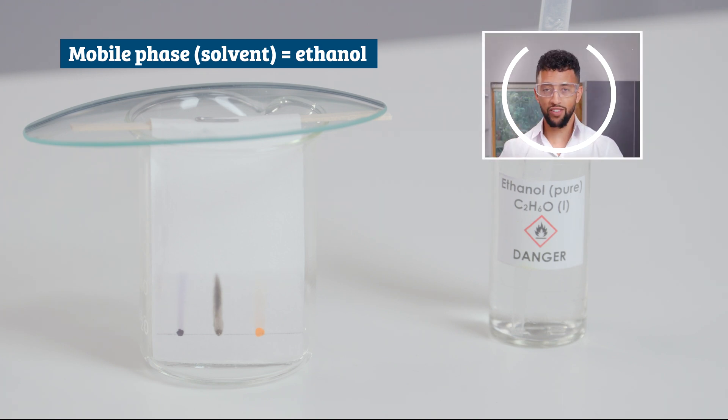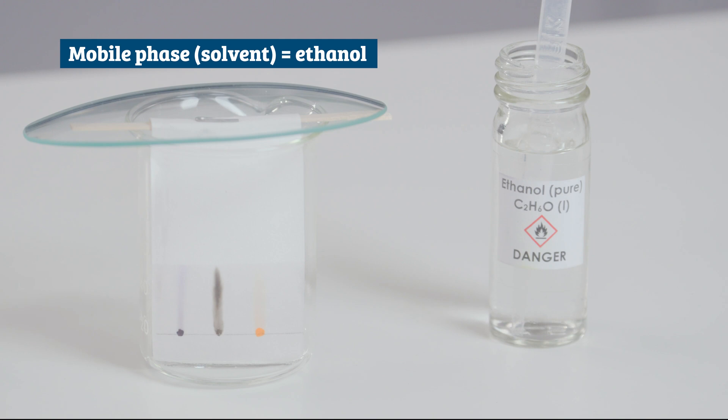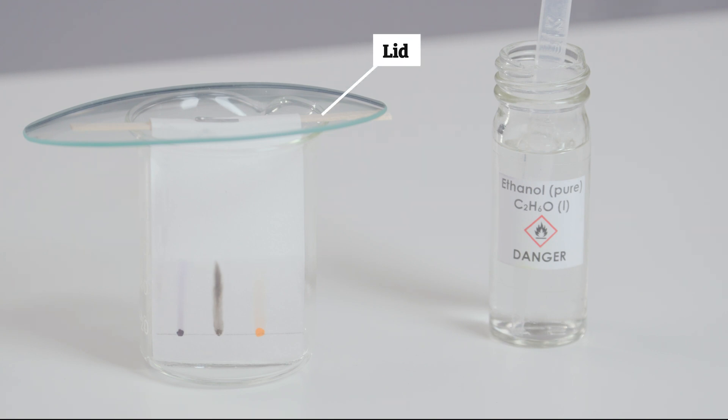If you test ethanol, make sure to wear safety glasses. Because ethanol evaporates easily, add a lid to the beaker when using it.